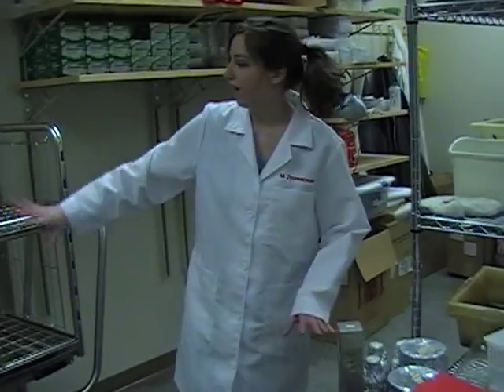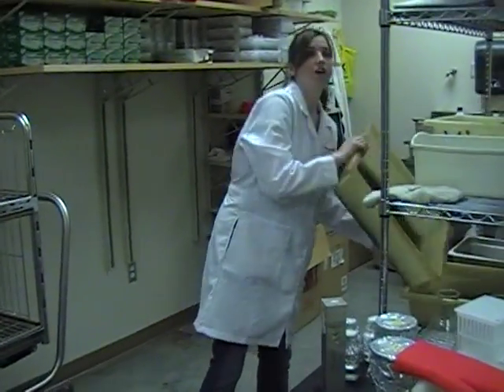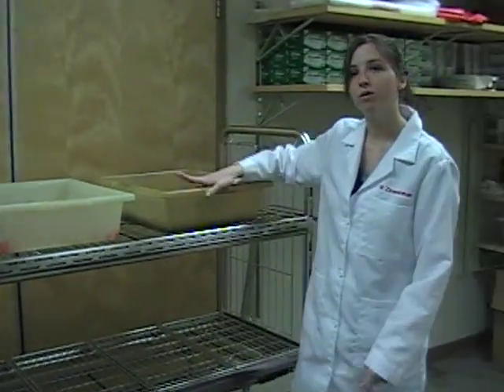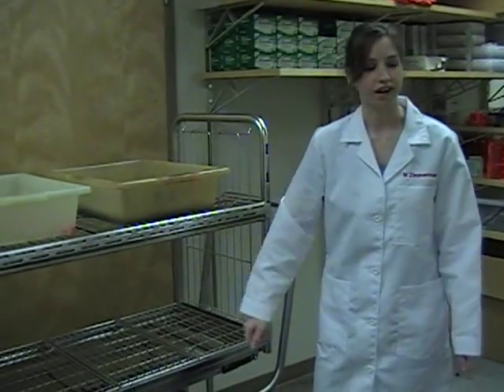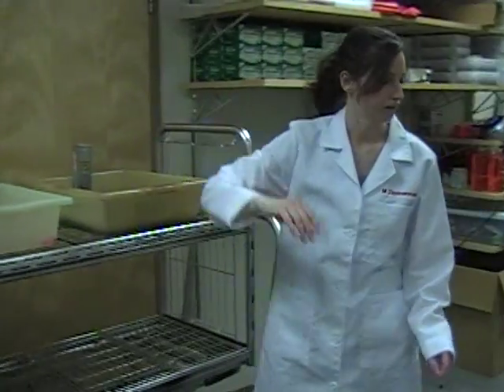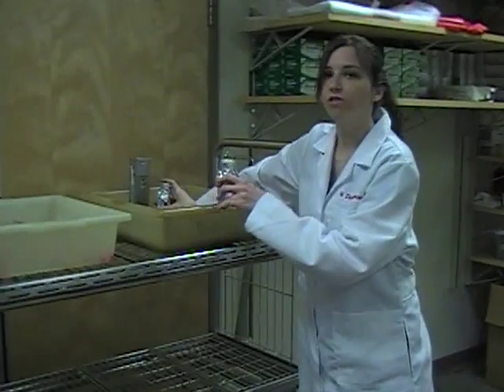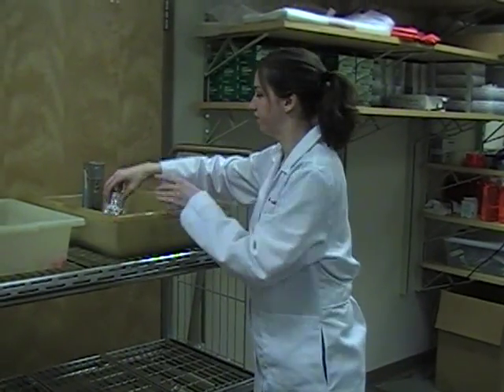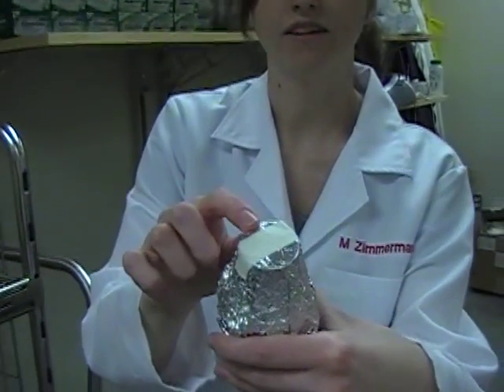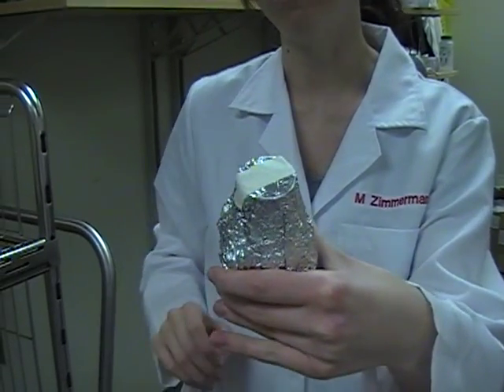If you're using items that you want to put directly on the cart but don't have appropriate containers, you can use special autoclave bin containers. Simply place them on the rack on the upper or lower deck and place your items into the autoclave. I have about 100 ml of liquid in these containers, so I would use cycle one. Make sure you have your autoclave tape and autoclave plastic. Notice there are no black stripes on here, which indicates this has not been autoclaved before.